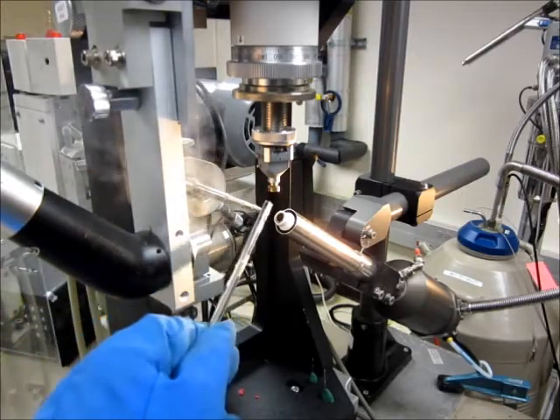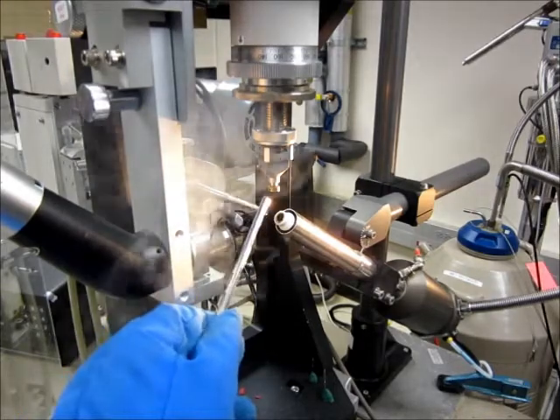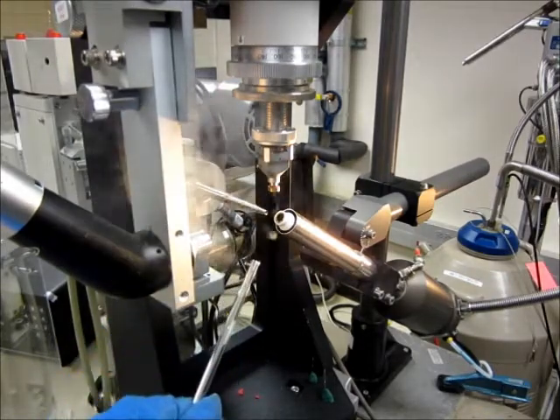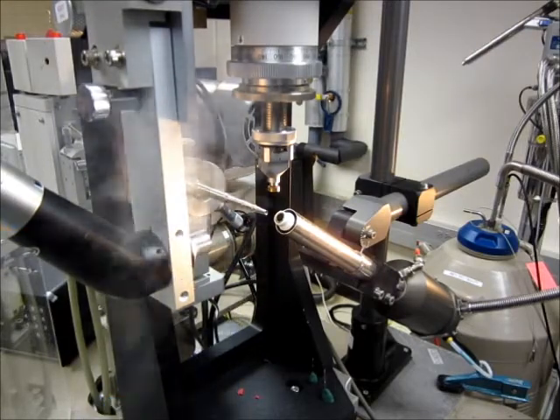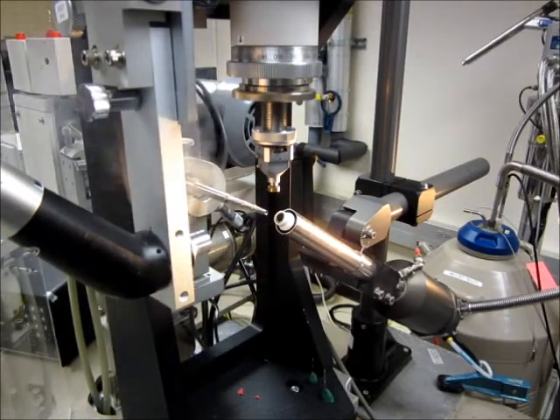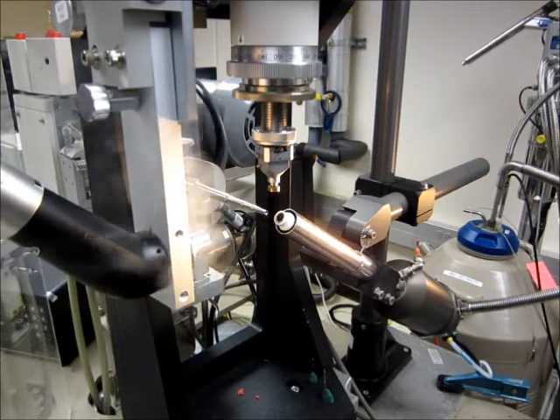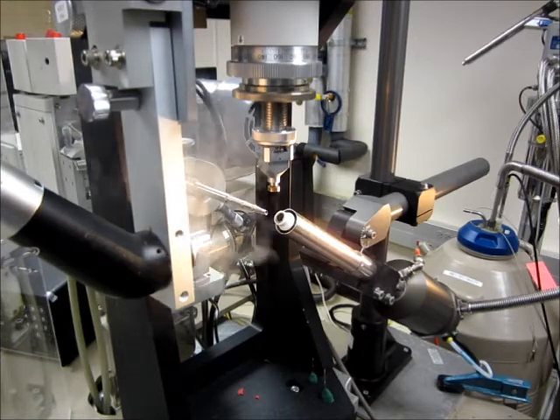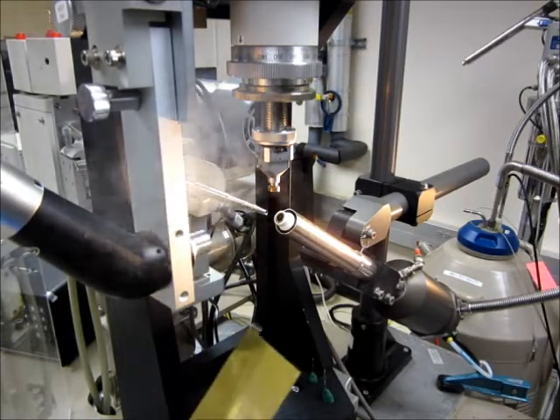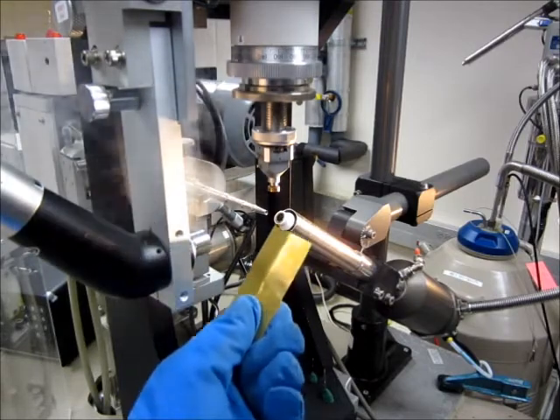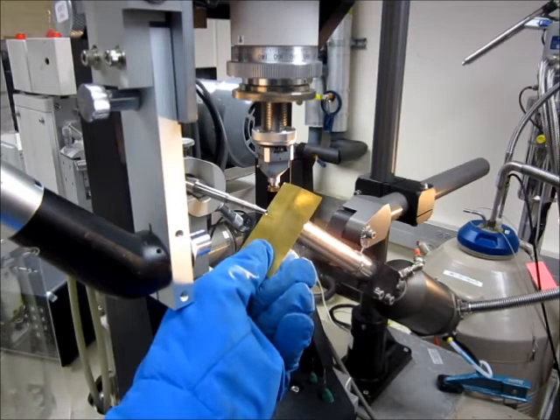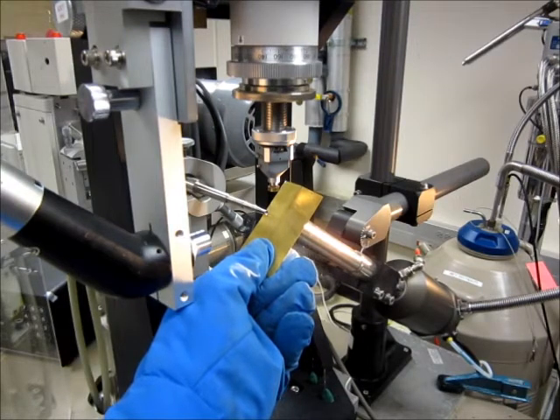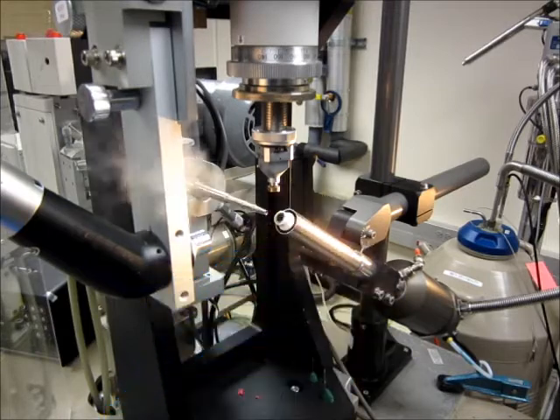The crystal will go on the goniometer magnet right here after I completely block the cryostream. I am going to demonstrate how to block it using a blocker which is a thin metallic sheet. I will bring the blocker and completely block the cryostream. When I am ready to flash cool a crystal I will simply remove the blocker quickly like this.